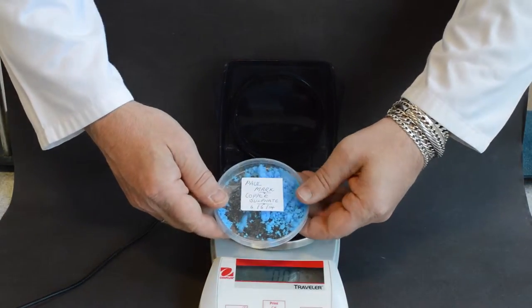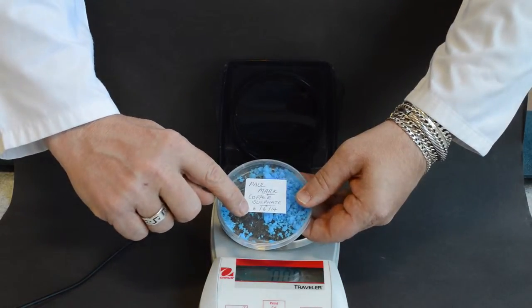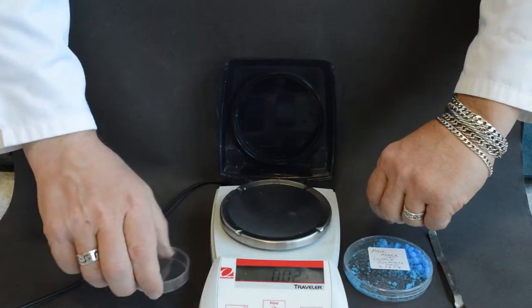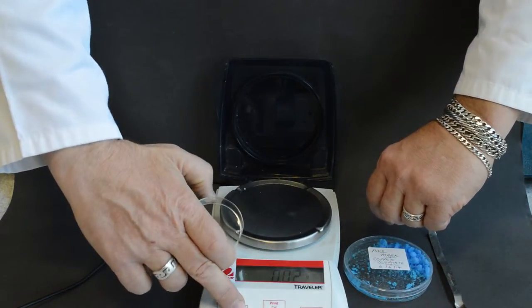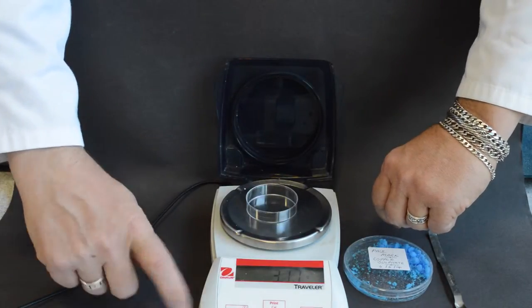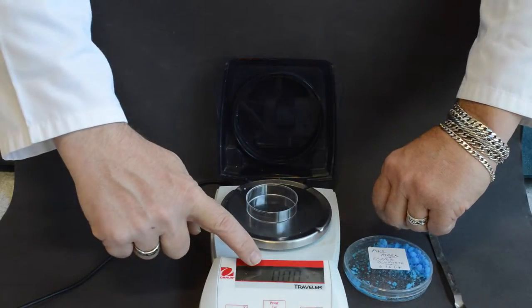Using your previously prepared sample, make sure it is dated and labeled correctly. Use a weighing vessel to weigh out your sample. Place the weighing vessel on the balance and zero the balance.